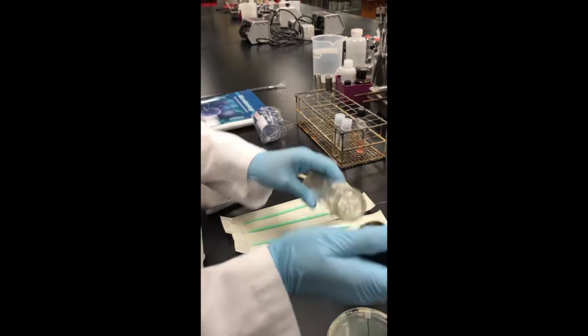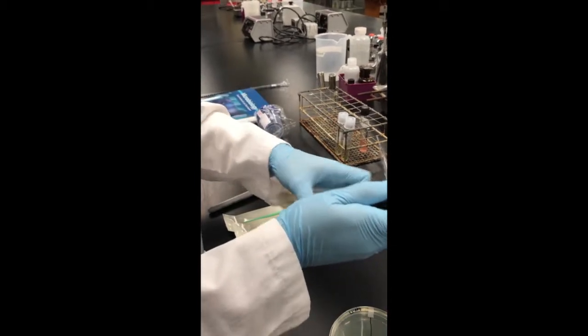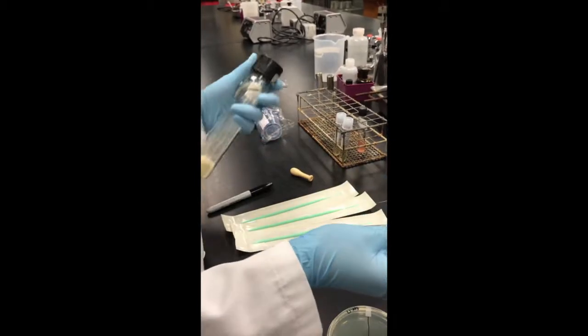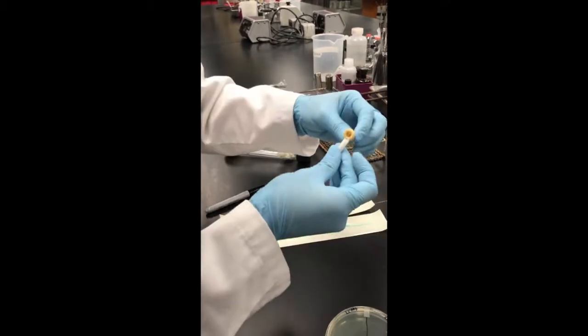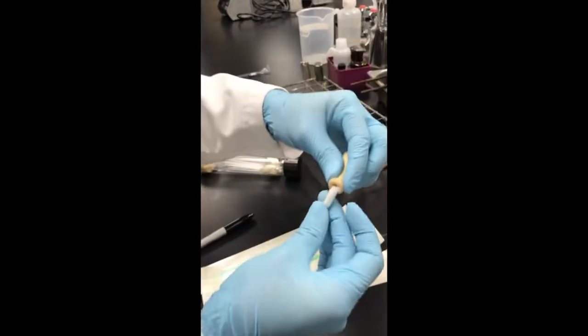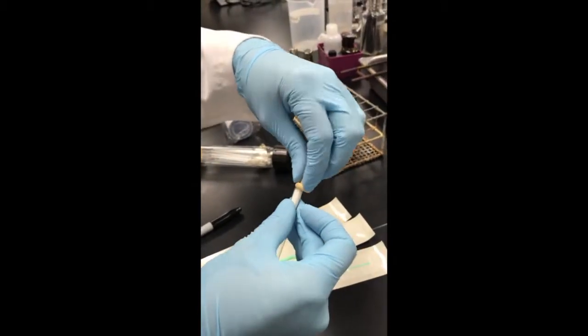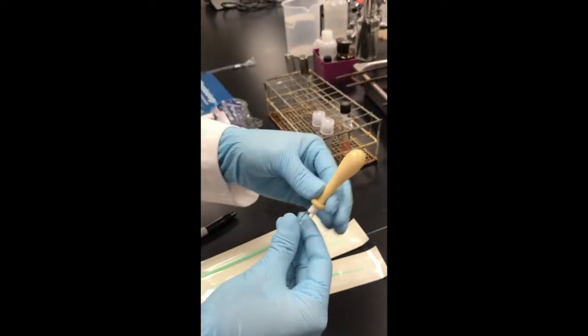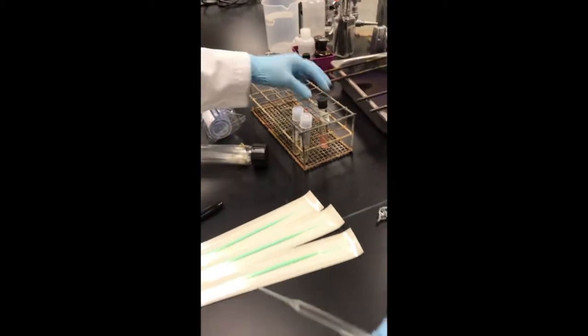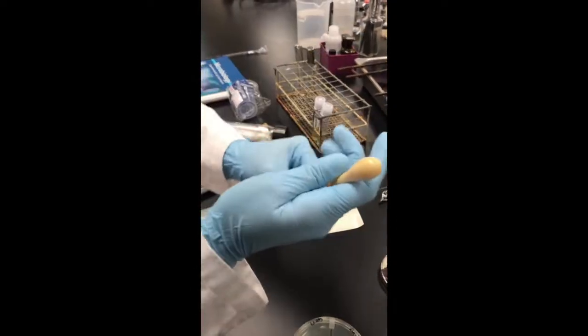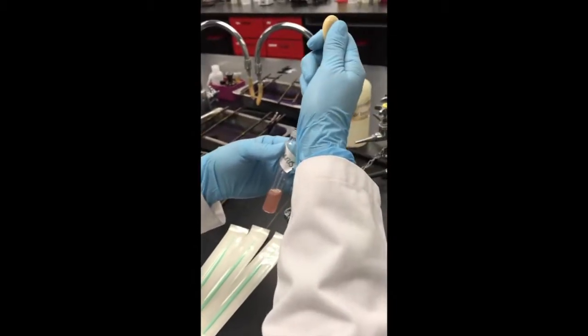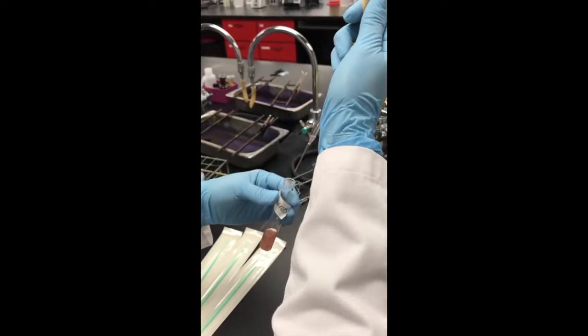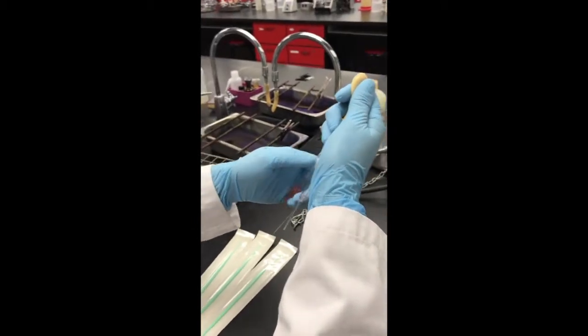There we go. And you're going to grab it, close the lid, and now with this one, you're going to use a bulb, and you're just going to push it on the end of your pipetter, and that's how you're going to draw up some of your serratia. You don't need very much because all you need is one drop.